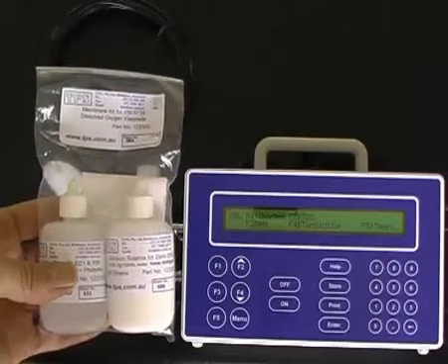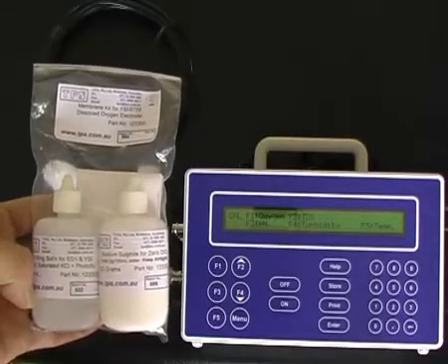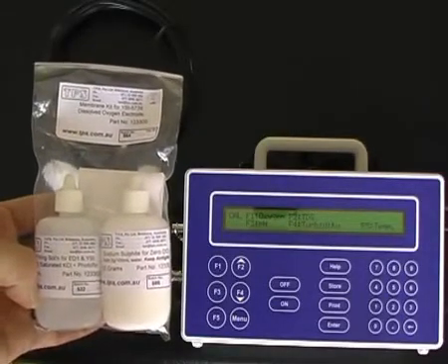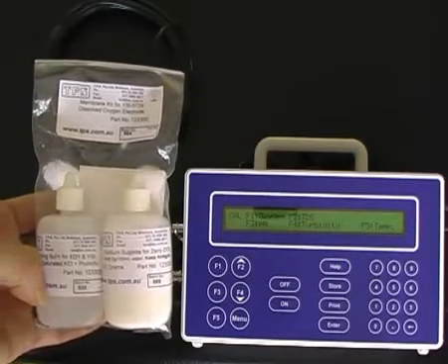The 90FLT is supplied with a dissolved oxygen membrane calibration kit, which includes sodium sulfite powder and a bottle of filling solution, as well as membranes and O-rings to fit the membranes.